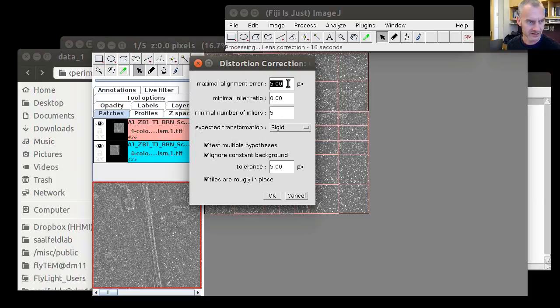This is where we change things. We expect a very, very small relative transfer error for small clouds of points, so we're assuming everything is relatively smooth. And we want to find all the corresponding sets of points in the image that support at least a rigid transformation, right? So we're not only expecting to find one model because the images are distorted, but maybe several patches that then after distortion would allow us to register them with a single model.